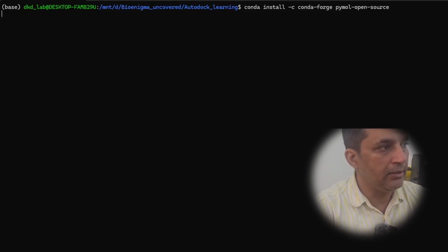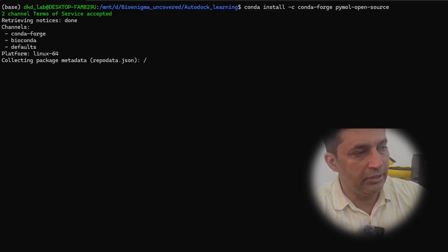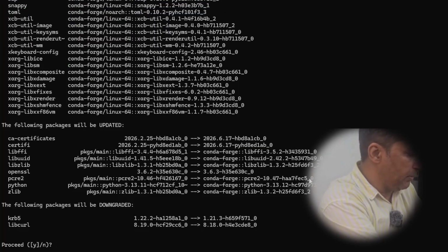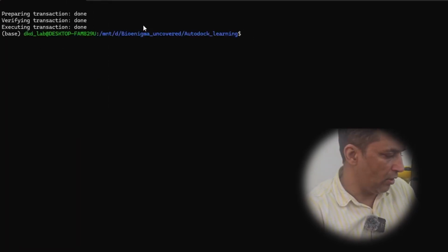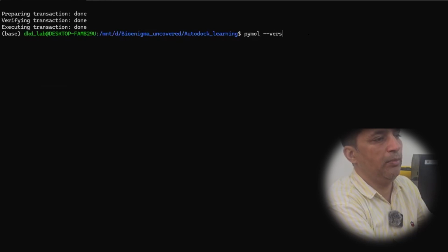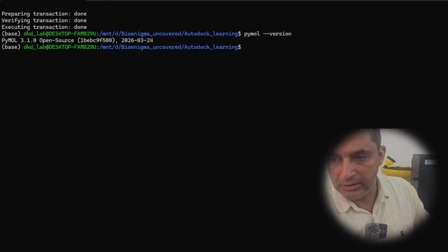Hit the enter button, and it is going to install PyMOL using this command within a few minutes. The installation will take 1 to 2 minutes depending upon your system. So it is asking me a prompt, proceed, yes or no. I'm going to type Y and hit the enter button. So you can see this installation process is now finished. I'm going to type pymol space --version, and it is saying 3.1.0, which verifies that my installation is successful.